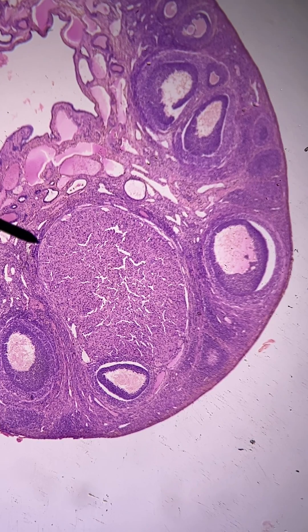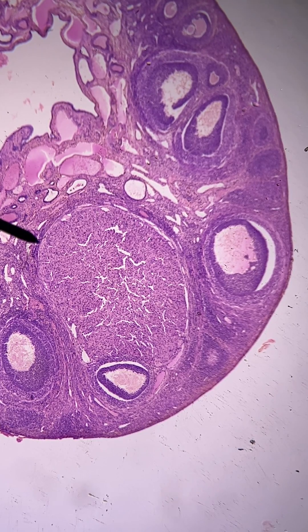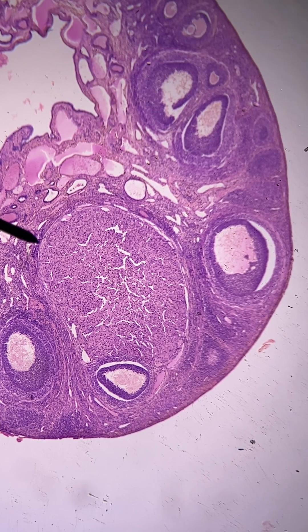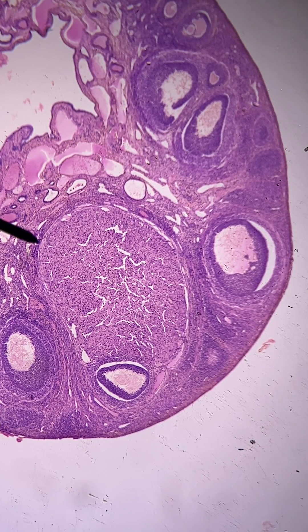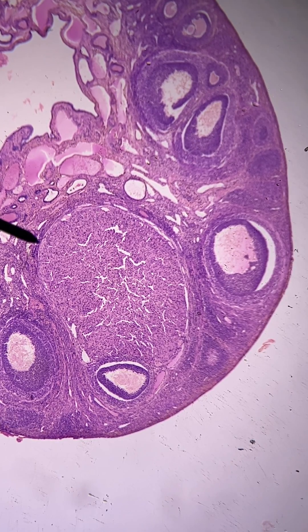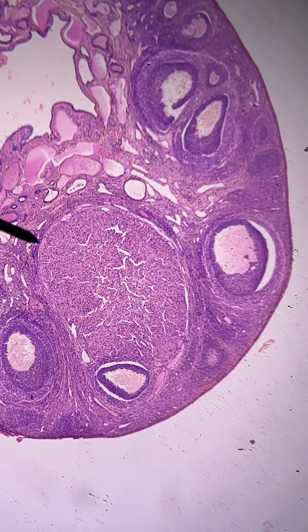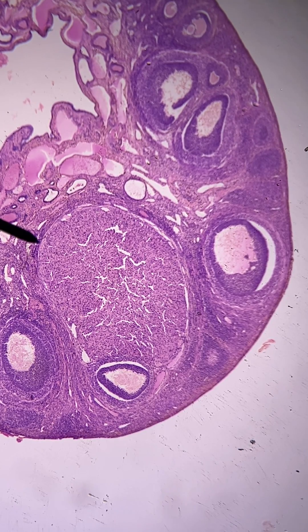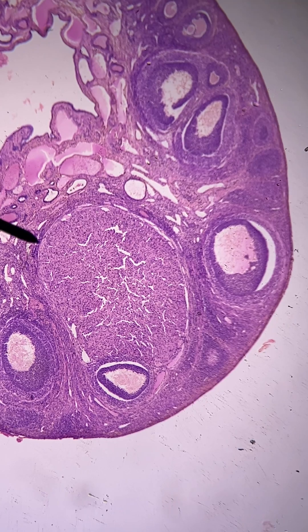The corpus luteum forms from the tissue that used to be the follicle after ovulation. The oocyte is on its way down the oviduct, and this structure forms, which then proceeds to produce progesterone and estrogen.